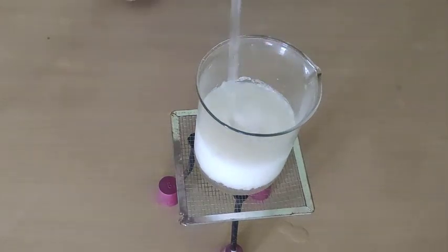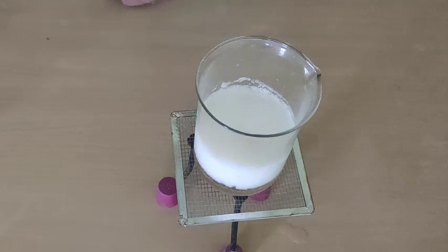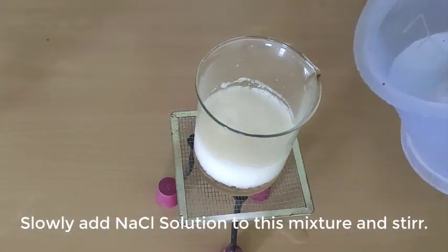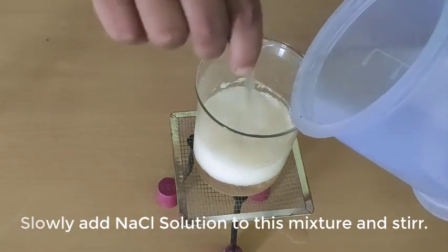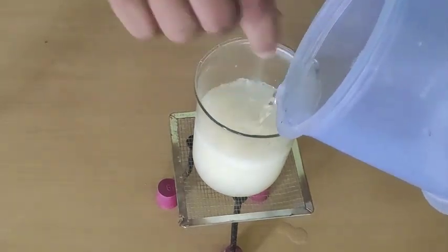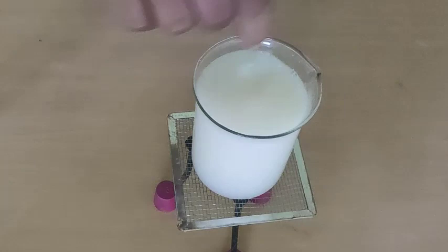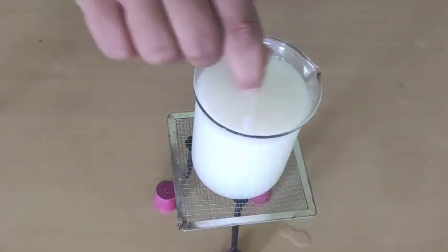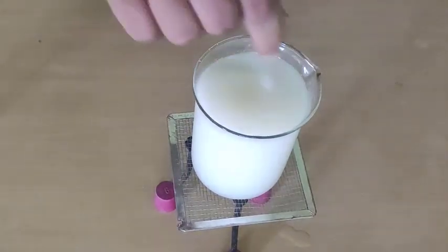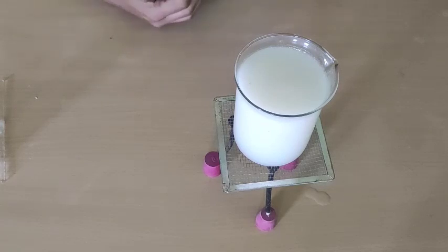While heating, remember to stir the solution continuously. We will continuously stir the solution for 10 to 12 minutes. Take care not to let the solution boil over — as we have taken a large beaker, there is minimum possibility of that. The solution has now been boiled for 10 to 12 minutes. We will now add the sodium chloride — that is common salt — solution into this mixture and stir it continuously. We have boiled the sodium hydroxide and oil mixture and then mixed in the salt solution. We will stir it and let it rest for some time.